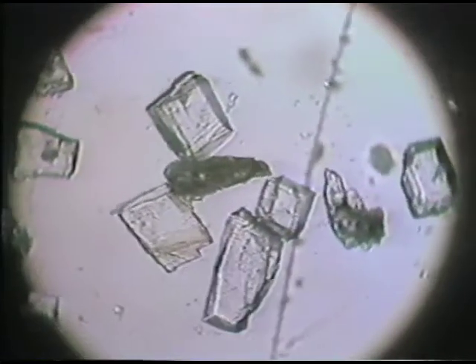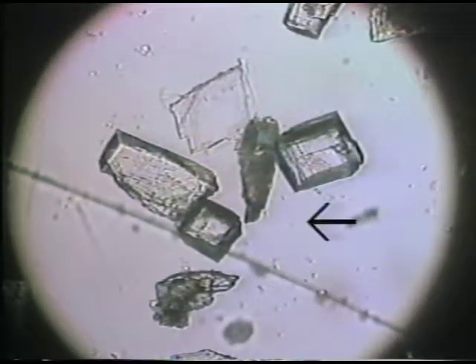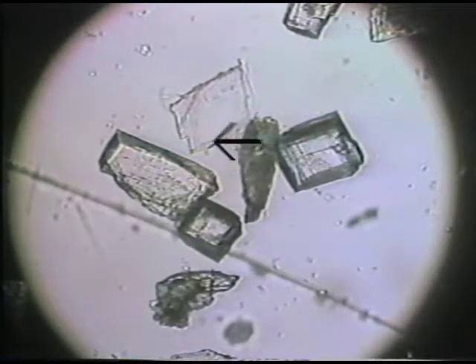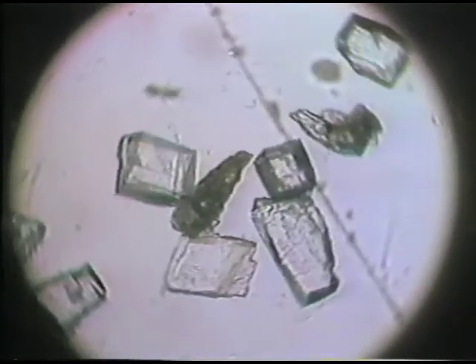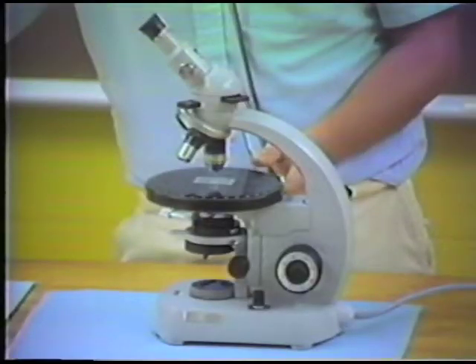It's characteristic of carbonates. And you can see this very well-developed rhombohedral kind of form, and anytime you break up calcite, it will break along these rhombohedral cleavage traces. And so this is a diagnostic cleavage form that occurs for carbonate kinds of phases.